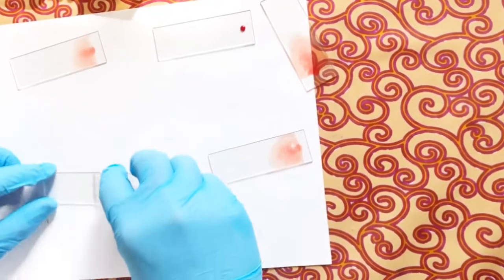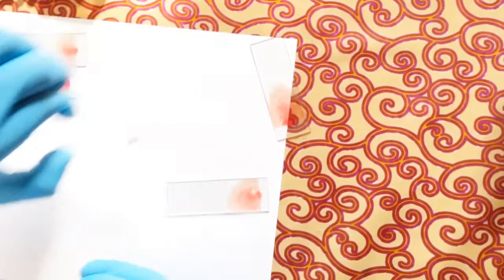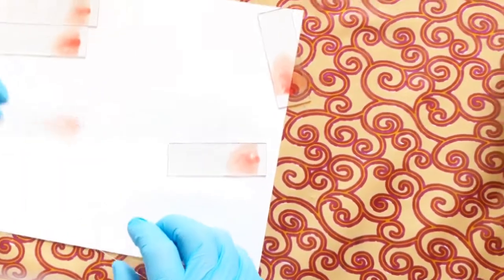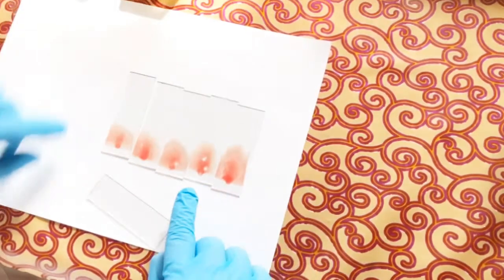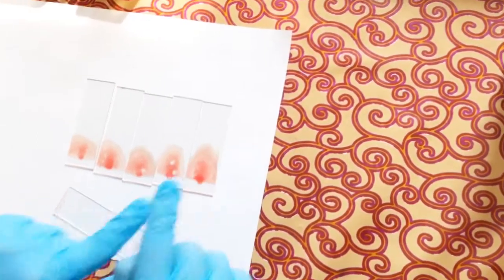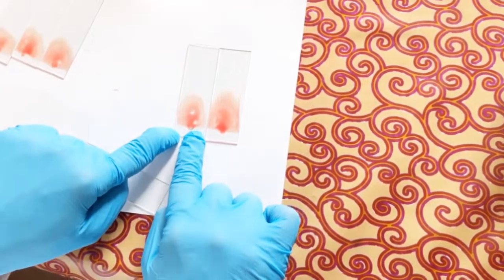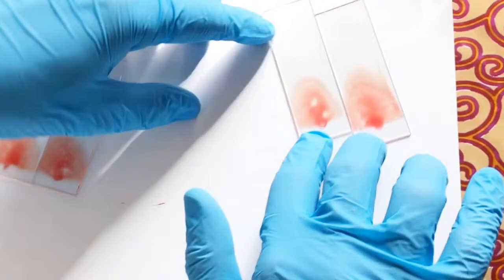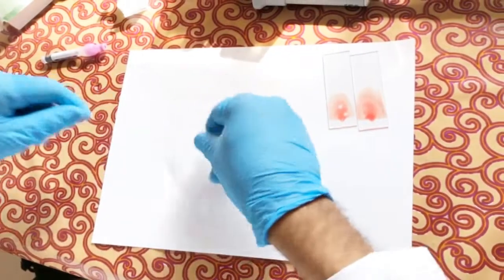Make sure you are not too fast and not too slow — spread the blood at an even pace. Some attempts here produced very small smears because the blood drop had started drying. Comparing all the slides, two of them look better than the others because they have more height and better length. Three of the slides are too small or have incorrect thickness or air bubbles. The two better slides can be used; the rest are discarded.